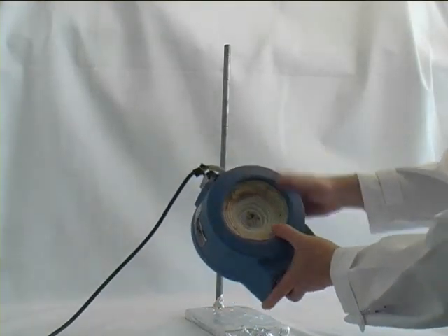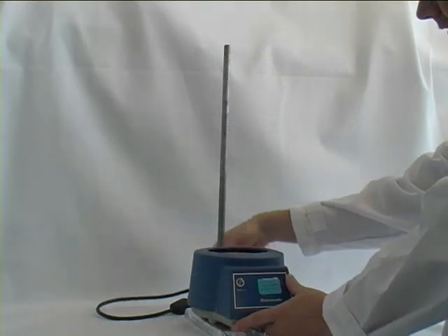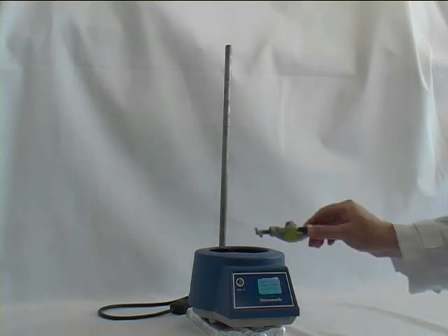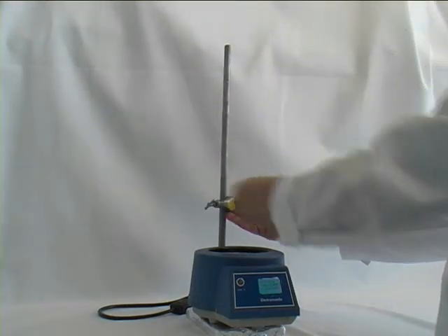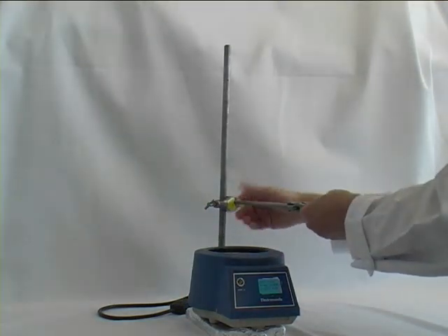As we are going to use an electric heating mantle, we are going to assemble that onto the retort stand, fix it at the back, and then we have to add a boss and a clamp. In this example, we will have to use two.